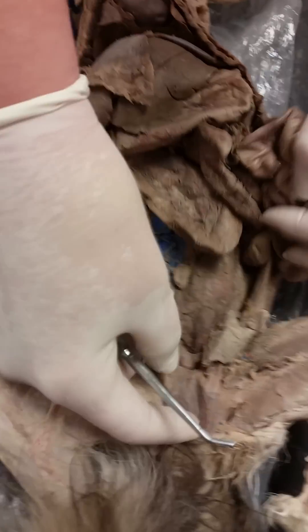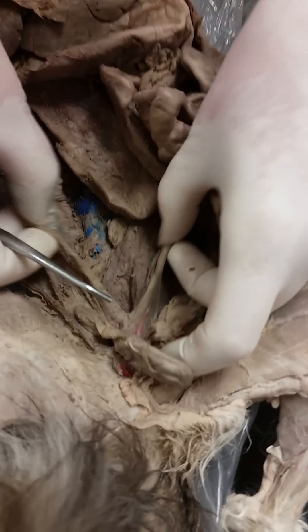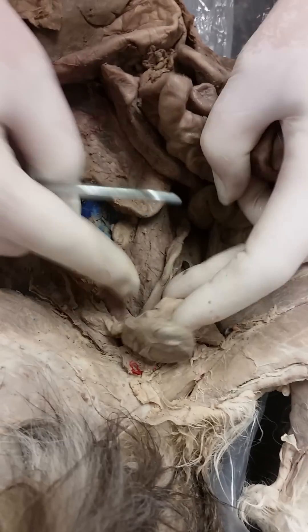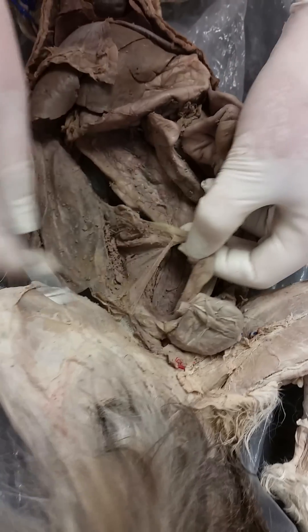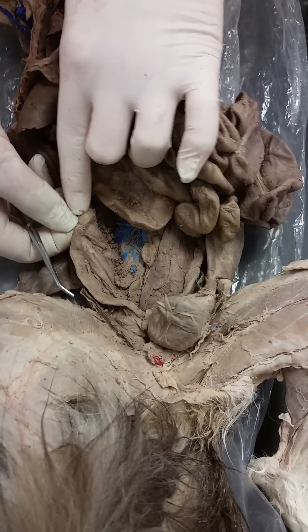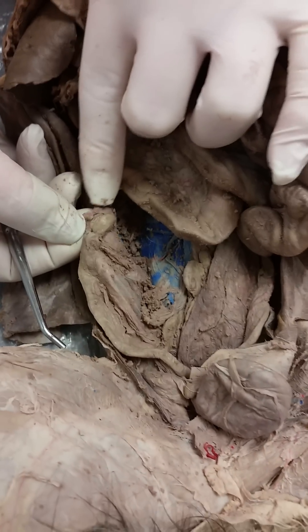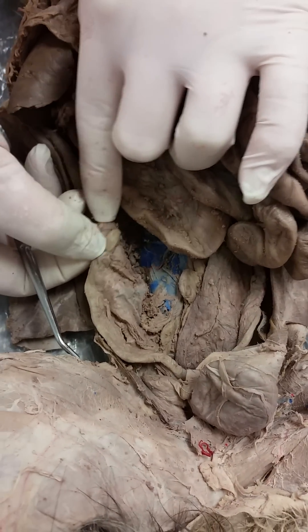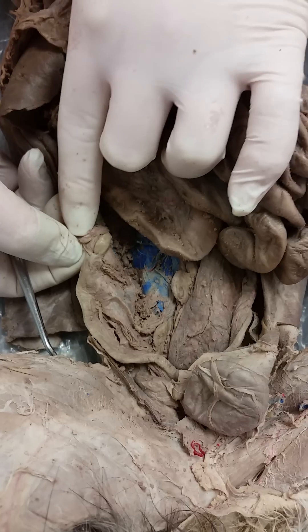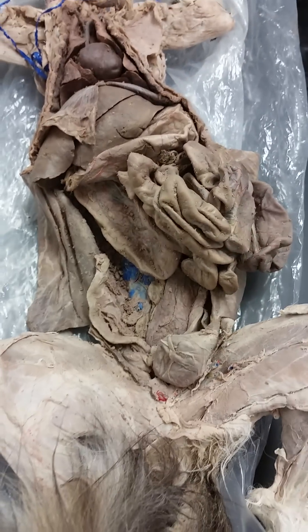Over here, the female reproductive parts. We have the uterine horns that come up on either side, so they're going to come all the way up. And the little bean that you see, that is the ovary. And then surrounding the ovary is the oviduct — that little curly Q is the oviduct. The end.